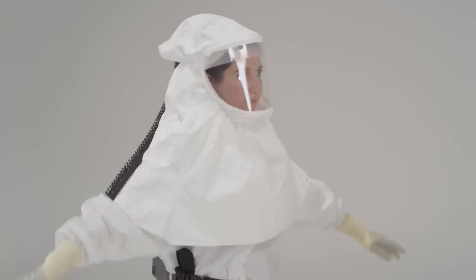When moving in the PAPR equipment, be sure to move slowly. Okay, everything looks great.